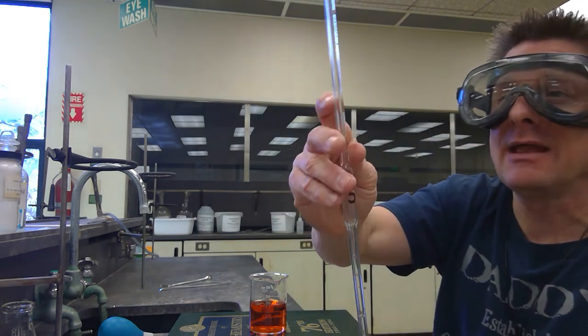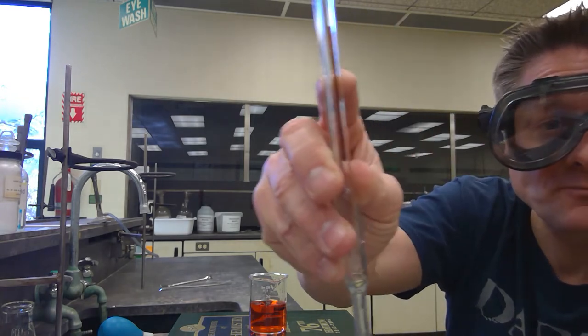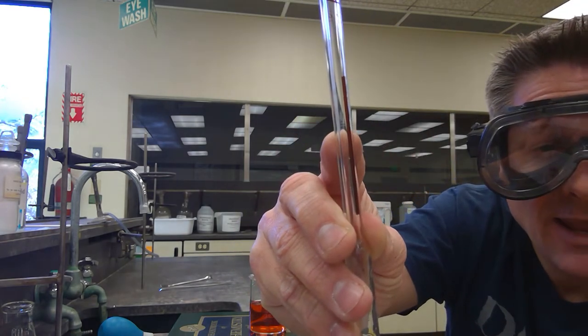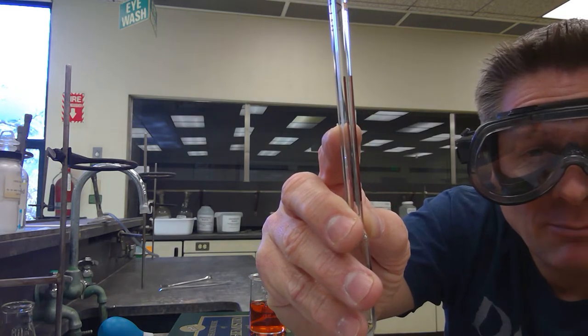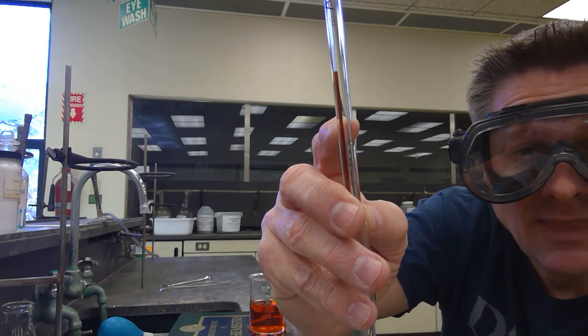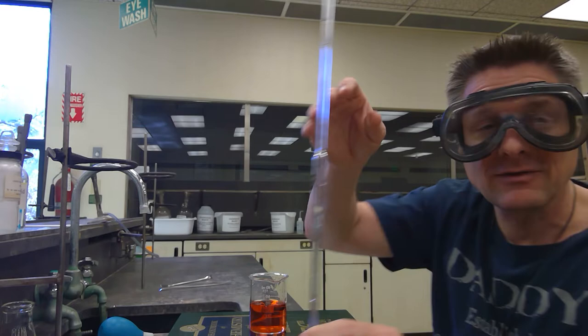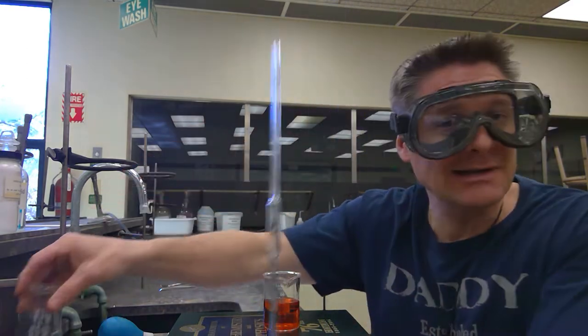If you fill it up to the line — which a lot of times is hard to see — there's a little white line right where my finger is. If you get the solution meniscus bottom directly on that little white line, that's going to be 5.00 milliliters. And you can transfer that 5.00 milliliters from some storage solution and dispense it into a flask or a test tube or wherever it's going. Or you could do a 10.00 milliliter aliquot.